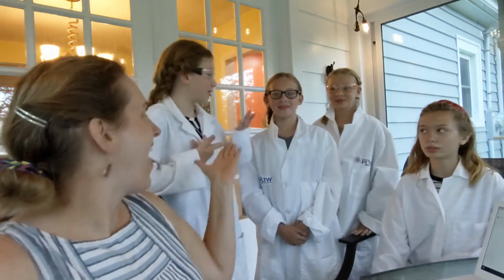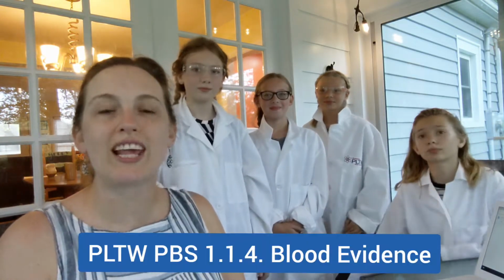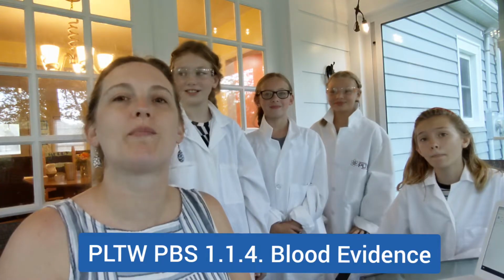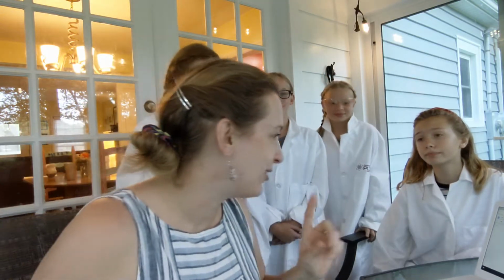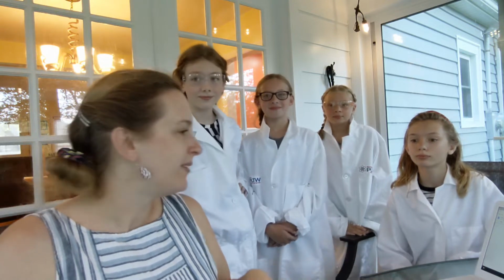And today we are going to show you how to do the Kastle-Meyer presumptive blood test, which is part of the PLTW PBS new curriculum for 114 blood evidence. Part 1 of this activity I'm going to do, and I'm going to show you how to run the blood test, and I'm going to show them how to do it. And then for part 2, the 4 of them are actually going to test 4 different blood samples.